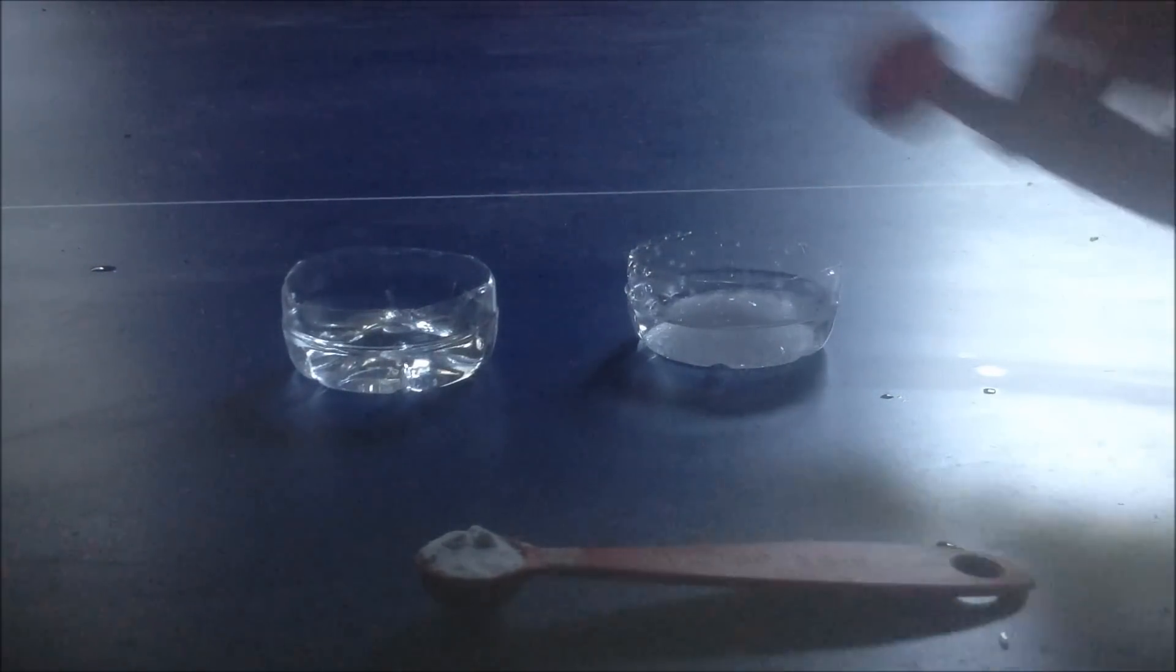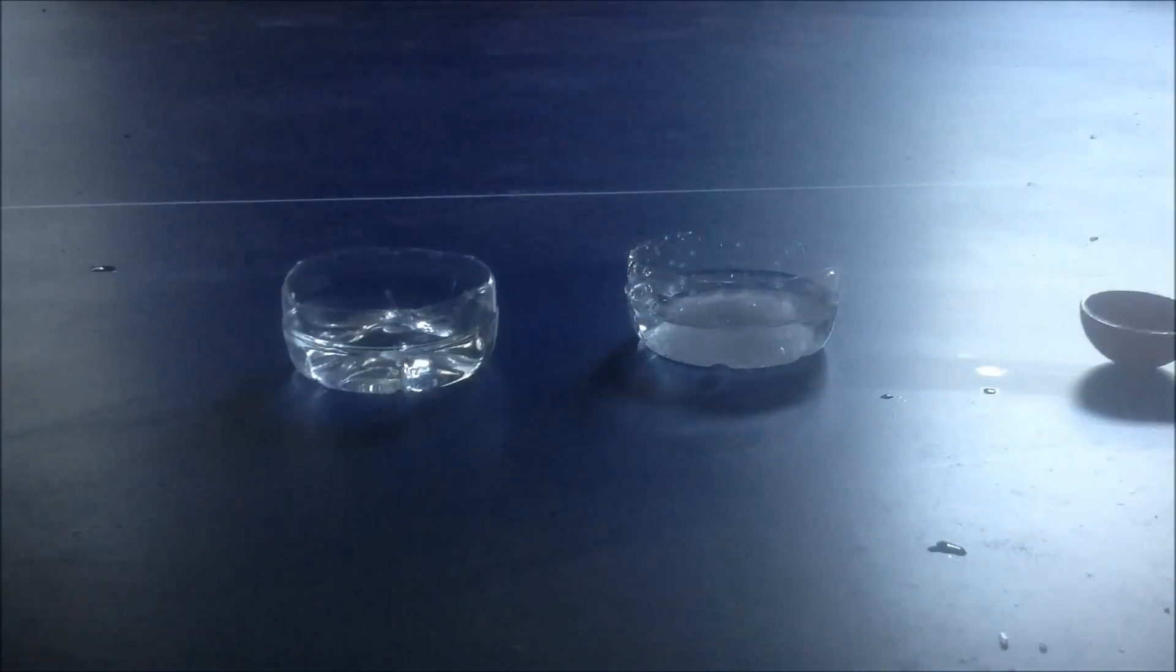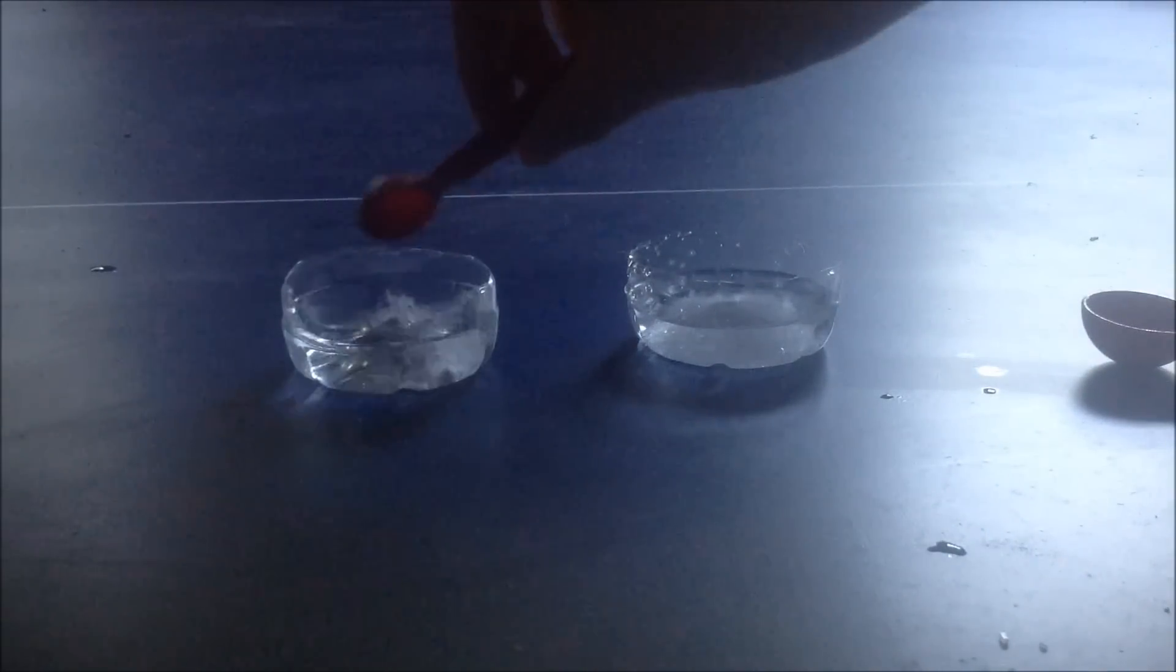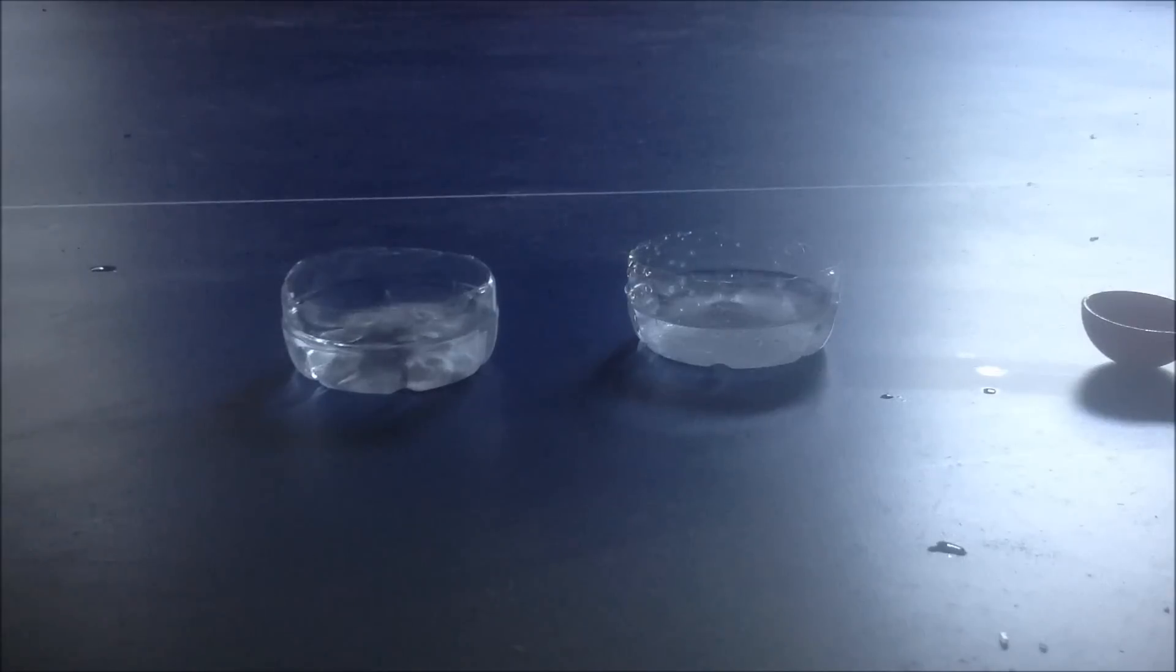Now all you need to do is put these two into a solution of water. Here I'm doing separate solutions so when I mix it, it's cooler. Now I'm going to let these two dissolve and I'll be back.